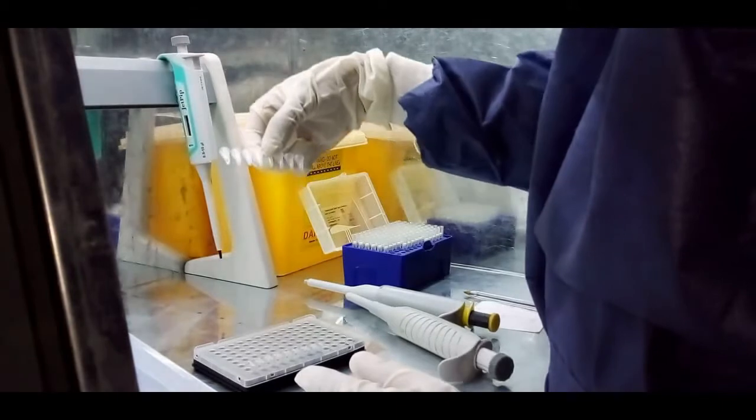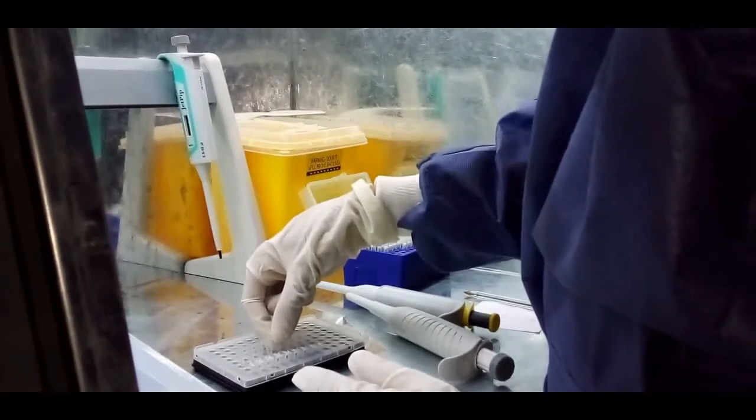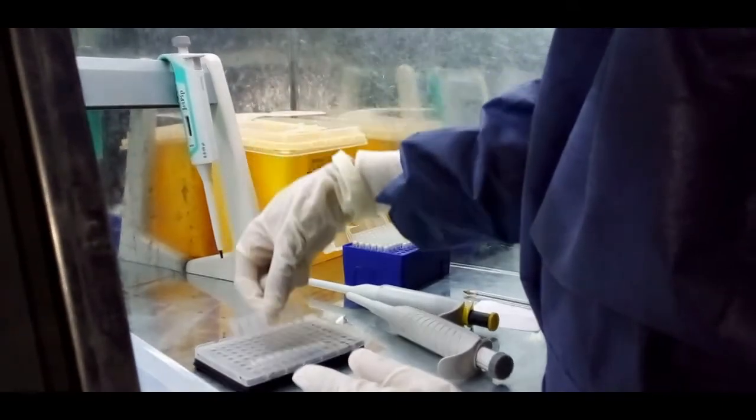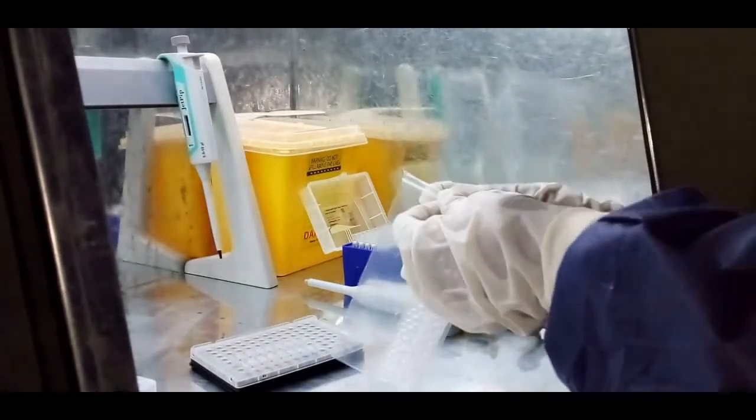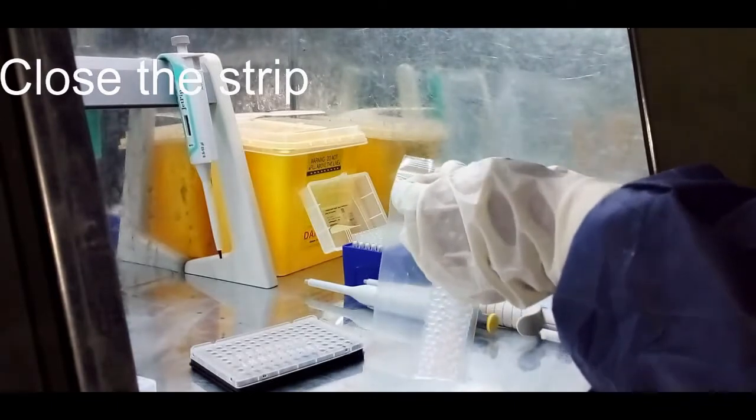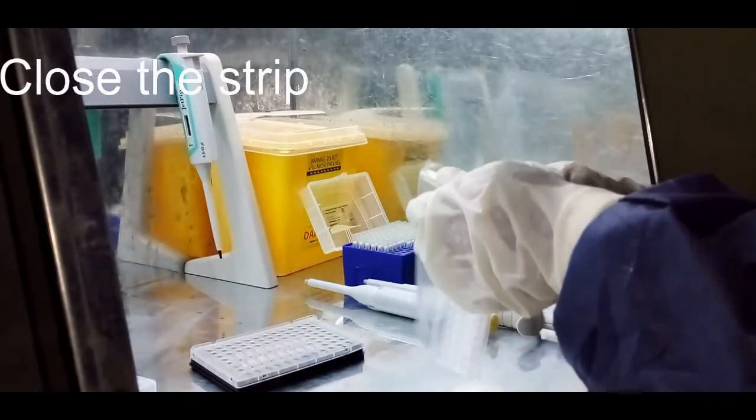Examine by naked eye. Close the strip of tube by stopper.